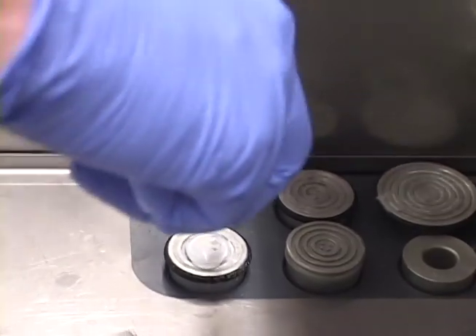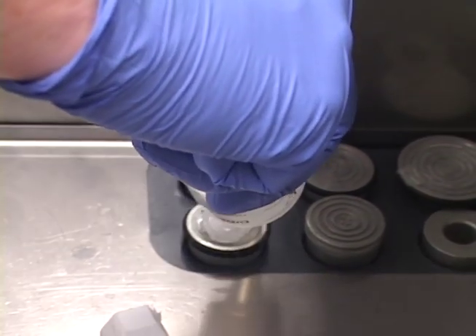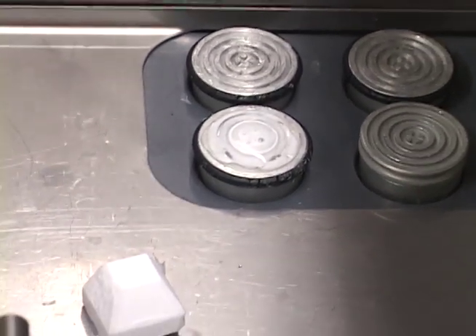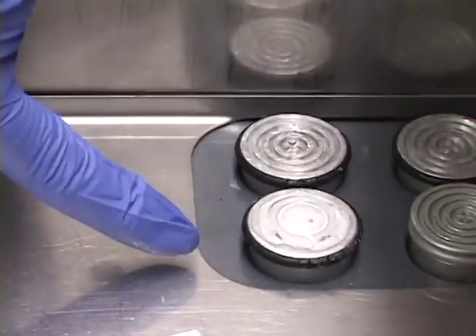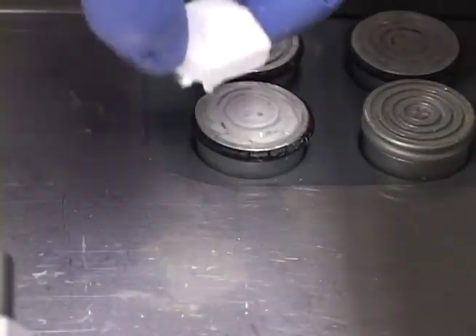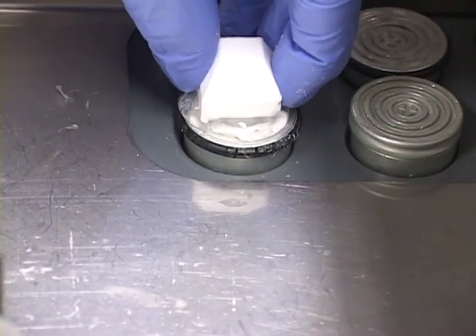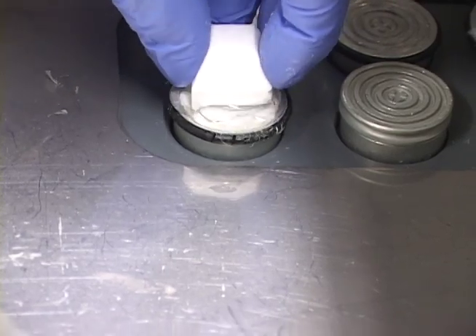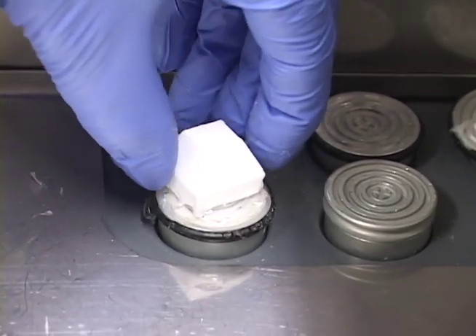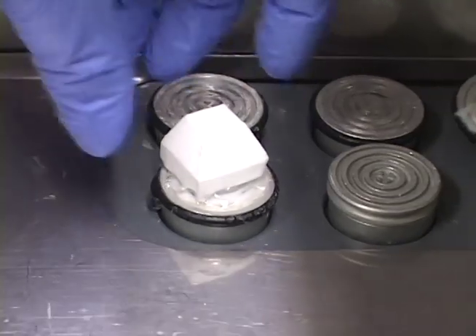I'm putting a little bit of OCT on there, and I'm going to wait until it starts turning a little bit white and frosty on the bottom to mount it, because I don't want it to thaw my sample too much. Now I see it starting to turn a little bit white, so I can mount my sample on here. You want to try and get it on there as evenly as possible — you're basically freezing or gluing it on, and then we'll wait a few minutes.